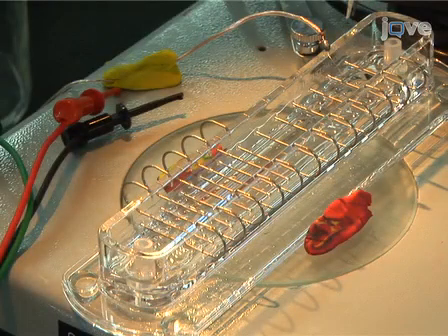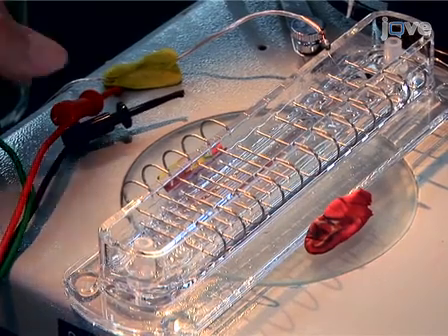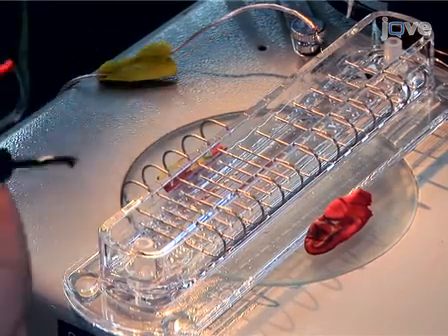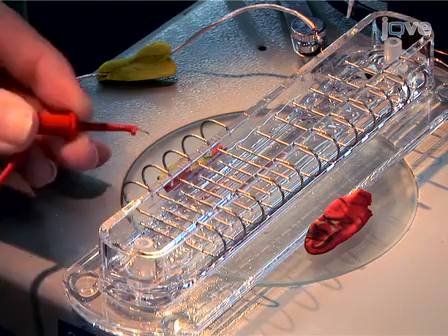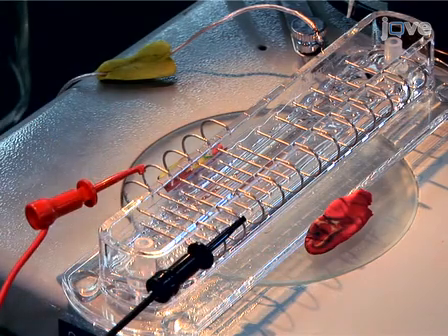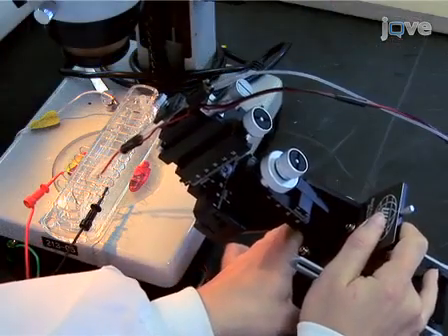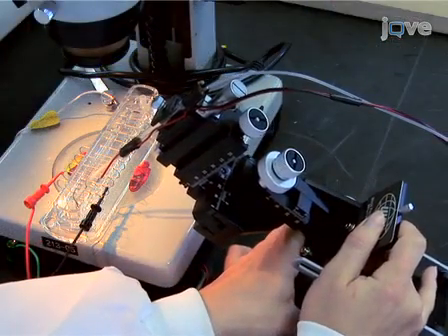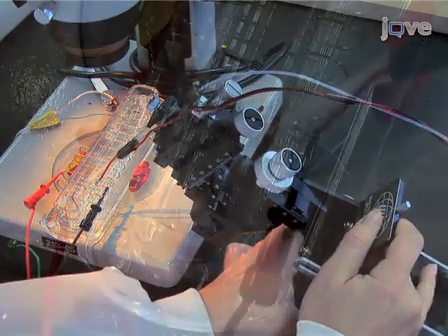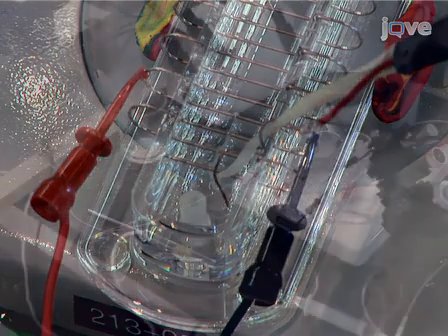Once the nerve cord is in place, attach the stimulator cable with the 2 mini hook leads to the nerve chamber. Attach the positive red lead to one of the external metal loops near the end of the nerve cord, and attach the negative black lead to the adjacent metal loop that is also in contact with the nerve cord. Use the manipulator to position the suction electrode near the end of the nerve opposite from the negative and positive leads. Carefully suction the tip of the ventral nerve cord into the recording electrode.